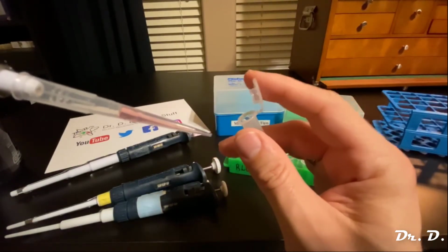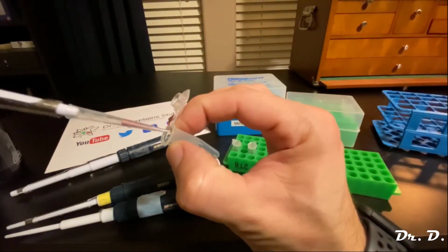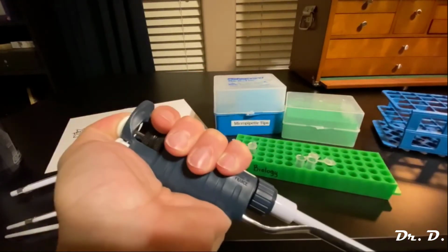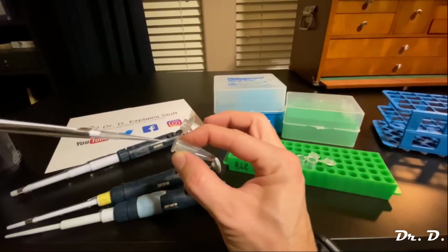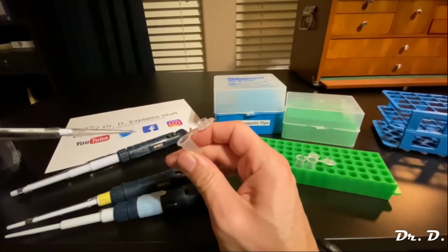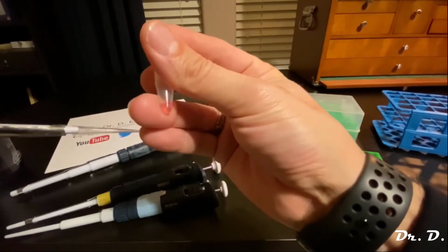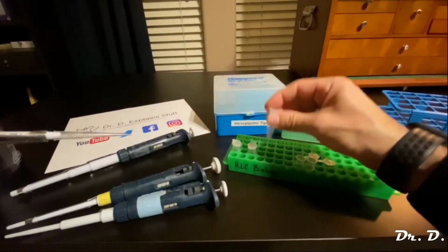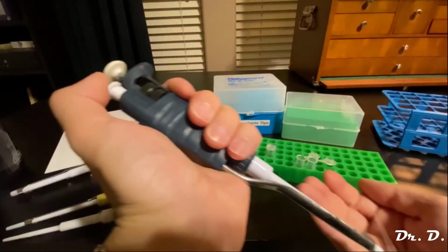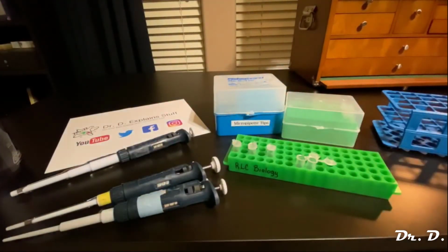It looks great. Okay, close this one. Grab the next epi tube. Place the tip in there and slowly push the button, and then go to the second stop, right? And then don't let go until you've fully brought the tip out of the epi tube. Okay, and then you can let go of the button. Close this and look at this. That is actually 80 microliters. Again, when you eject the tip, you push the ejector button and that spits the tip out into the trash. Okay, and that's pretty much it.